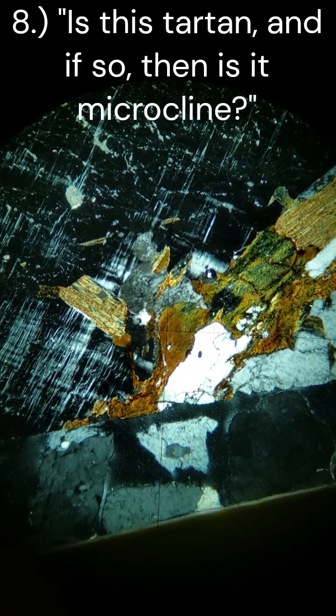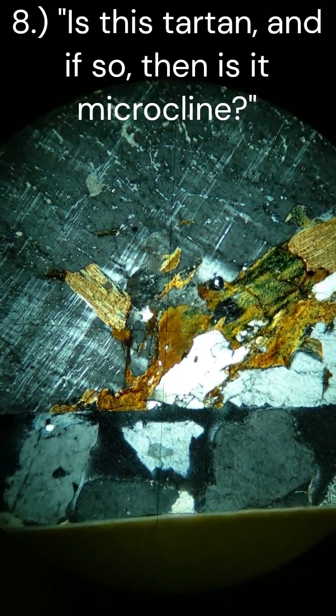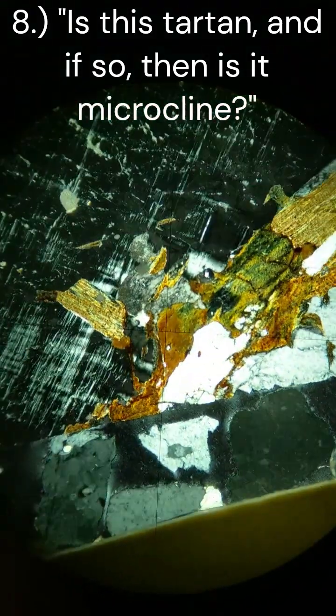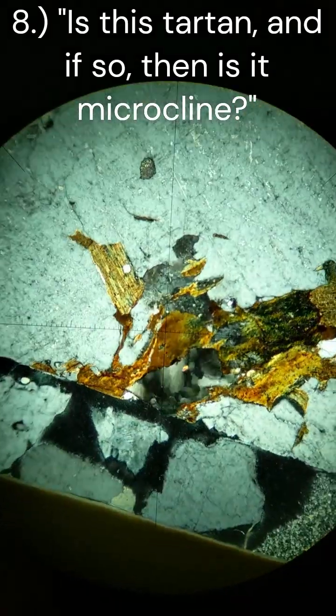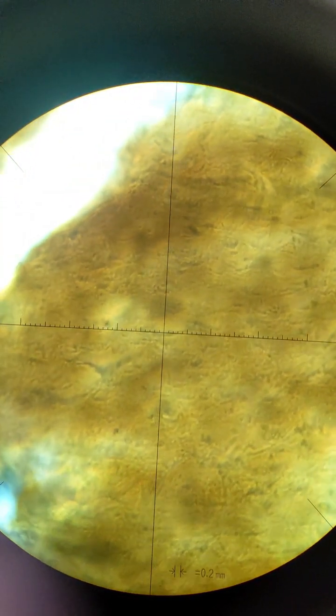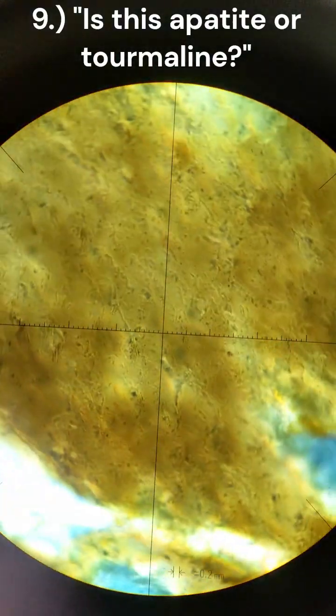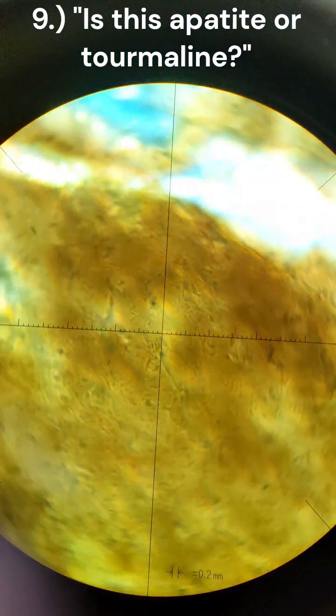We are in thin section 95 again, PPL, 4x zoom. Going to crossed polars. I believe that is tartan twinning in the surrounding black mass, likely microcline or some other feldspar. Moving into the 63x zoom. This seems to be barely pleochroic, if at all.